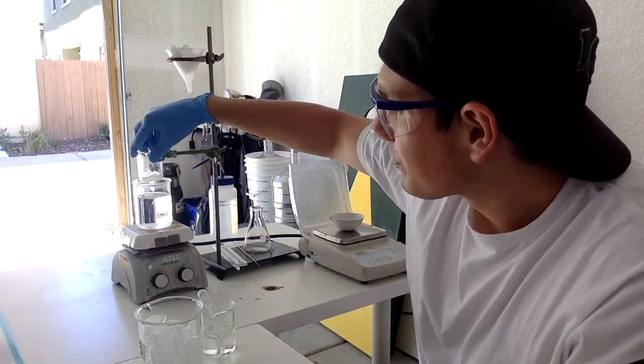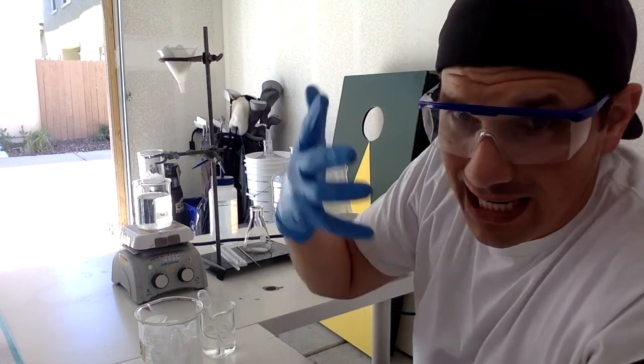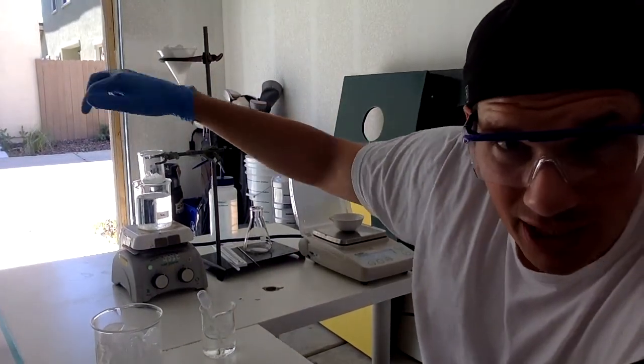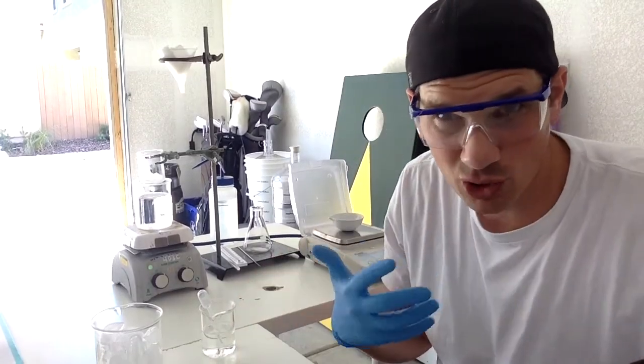All right, so the aspirin right now should be crystallizing. I'm going to put it over this ice bath right here to crystallize it out, which should take maybe 10, 20 minutes just to get the full effect going. So I'm going to add about 5 to 6 more milliliters of water into this so I can get all that aspirin. You can see it up on the side over here. I'm just going to try to get it all down into the flask and ready to be filtered out once it crystallizes.